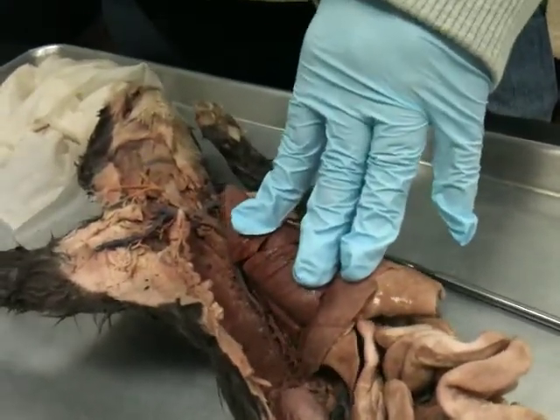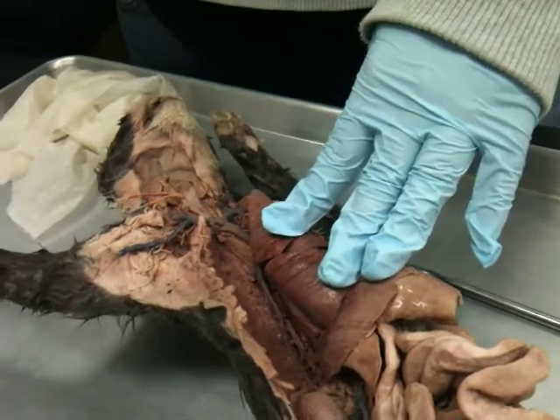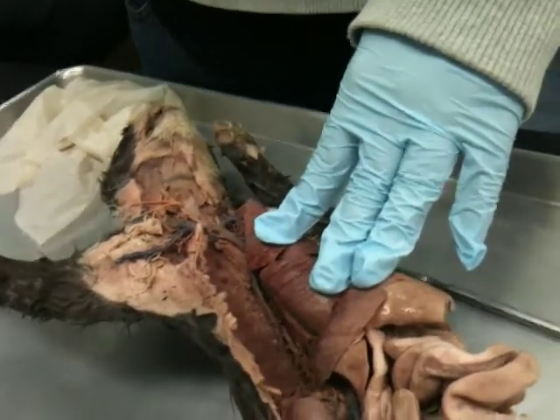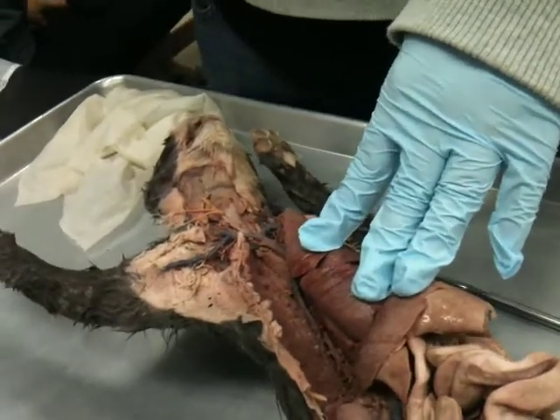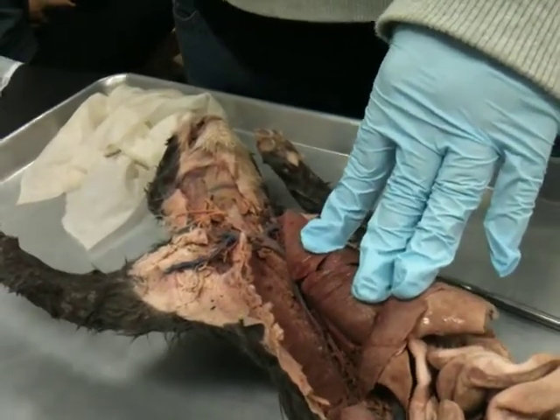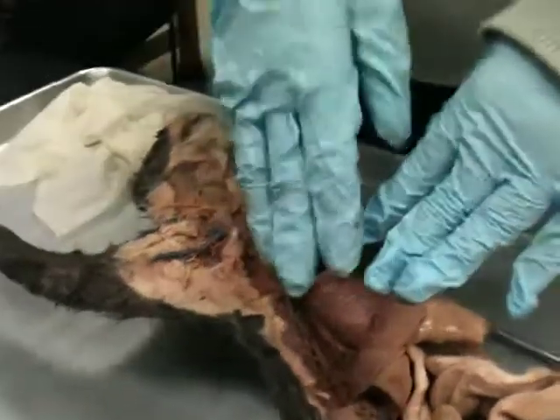Did y'all color the veins blue? Or are they essentially really injected with dye? Okay, that's it. Yeah. So that's why some of them aren't as dark, and usually the arteries, they're supposed to be bright red, but a lot of times, for some reason, the dye doesn't move as well.